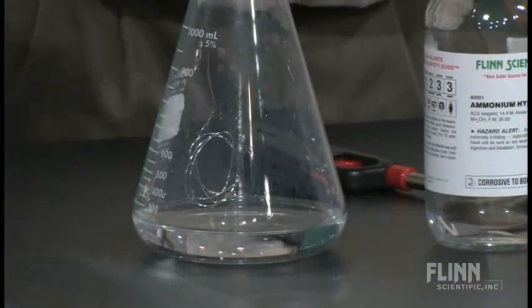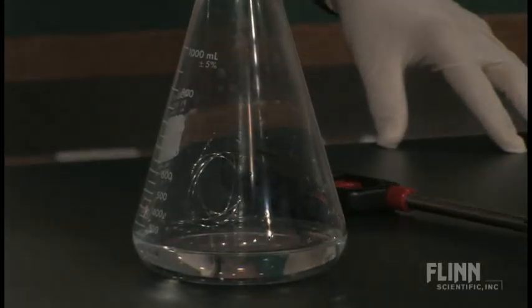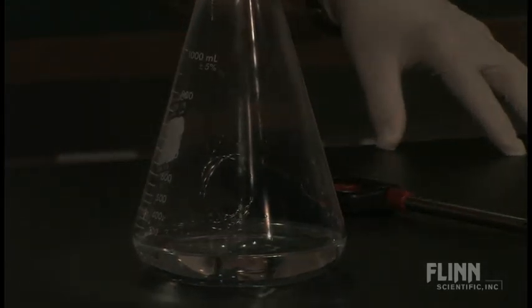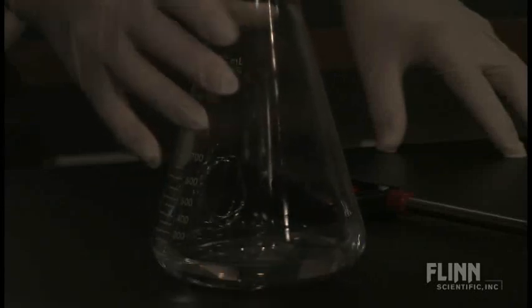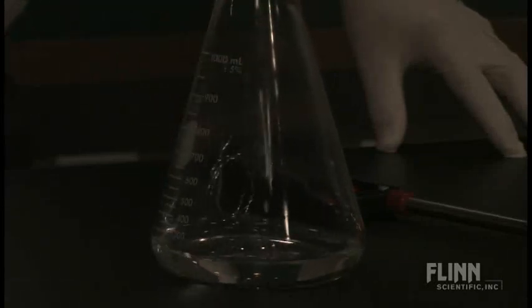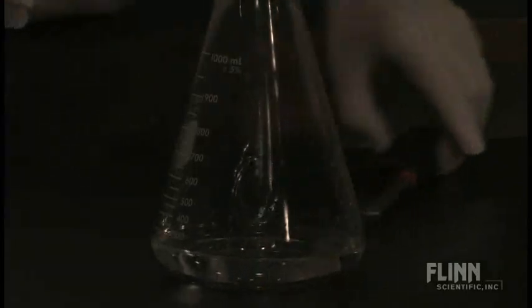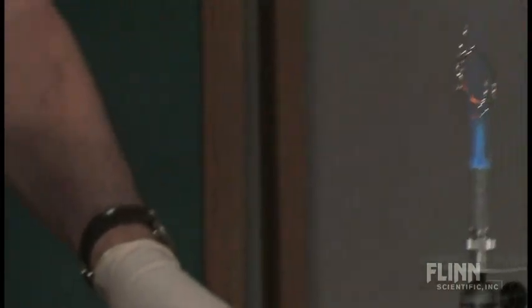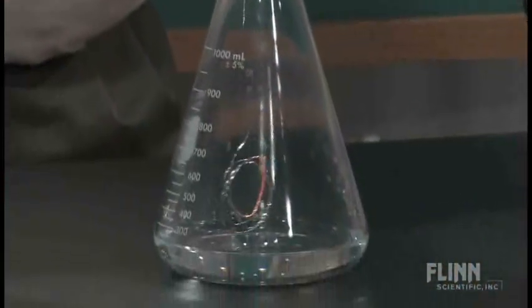And get it into the flask. If you dim the lights, hopefully we will see a red glow, just to release some more ammonia. I think I'll try heating that platinum again.